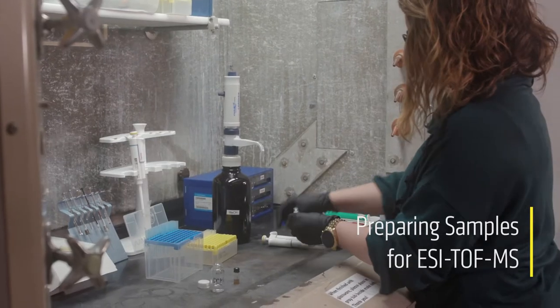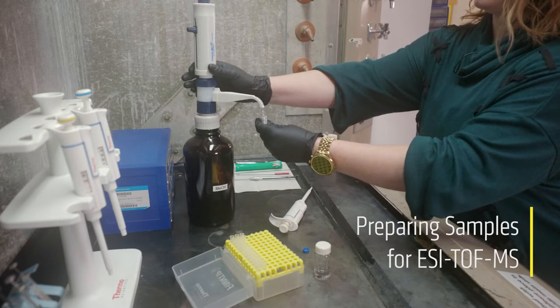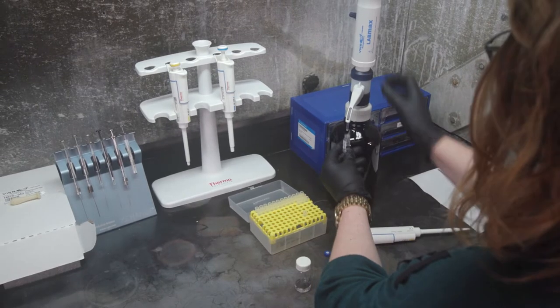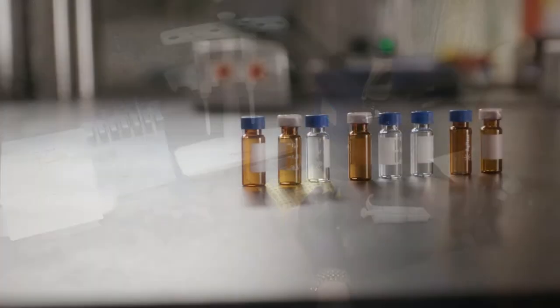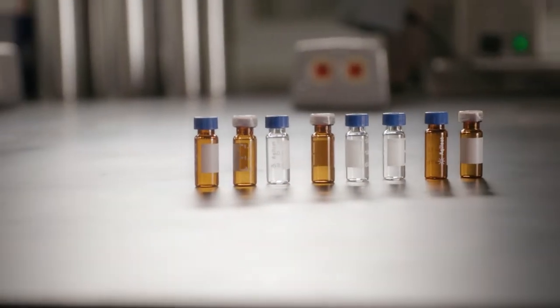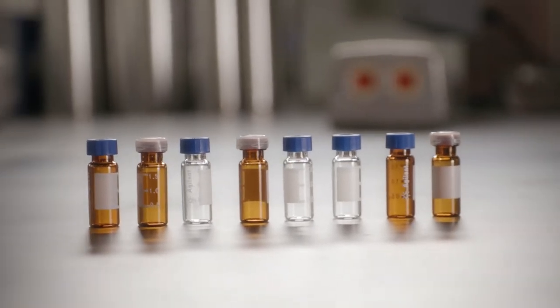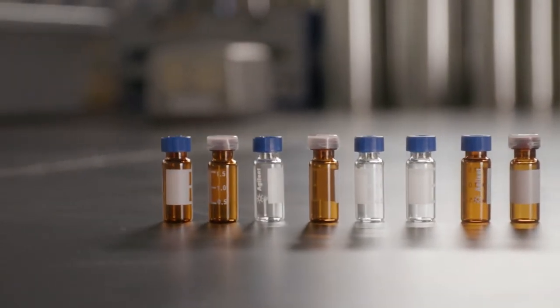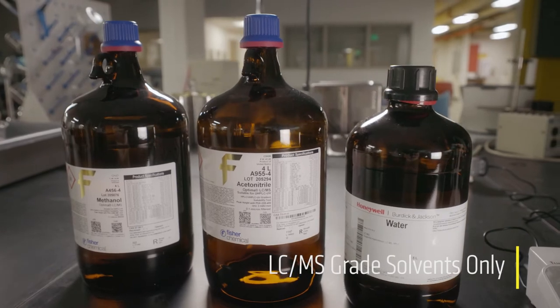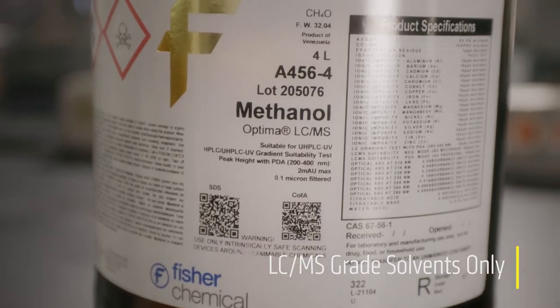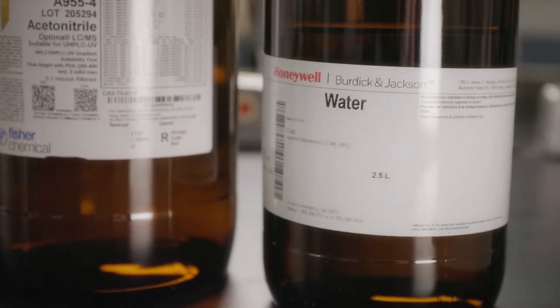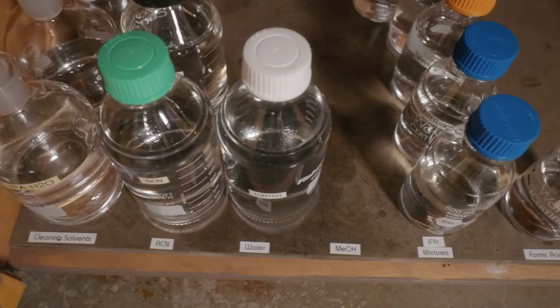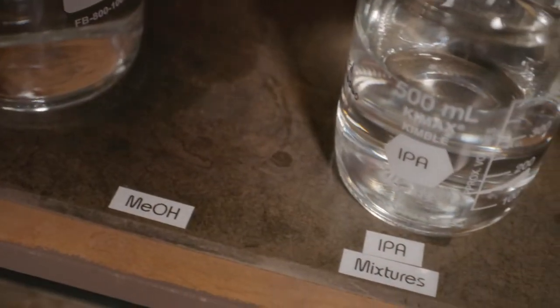First, I will show you how to prepare your sample for mass spec. However, we ask that you prepare your samples ahead of time in your own lab whenever possible. You will need LC-MS compatible sample vials. Most standard two milliliter autosampler vials will work with this system. When preparing your samples, make sure to use LC-MS grade solvents. Methanol, acetonitrile, and water are the preferred and primary solvents used on this system.